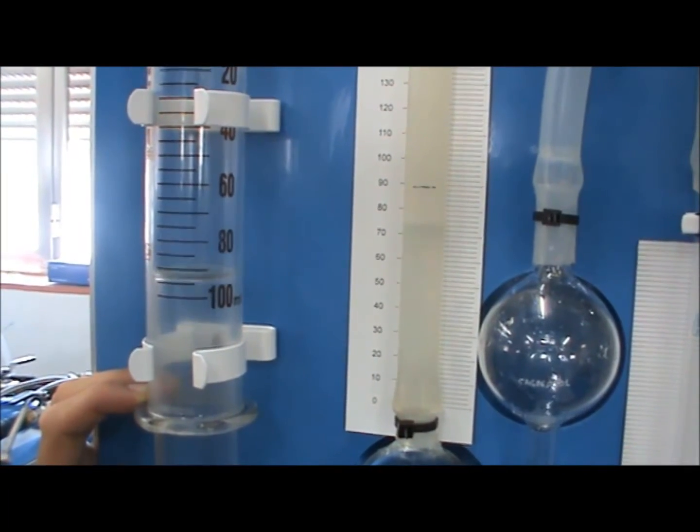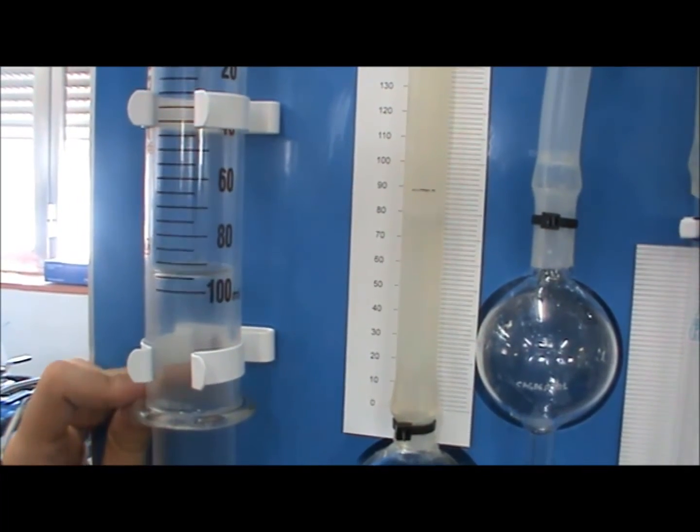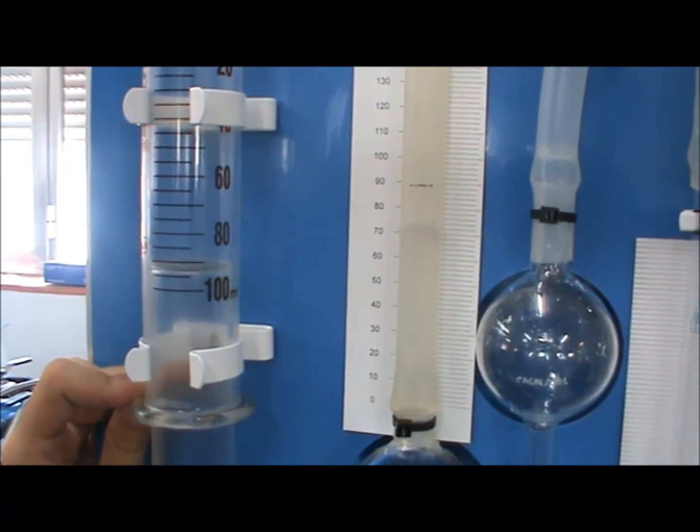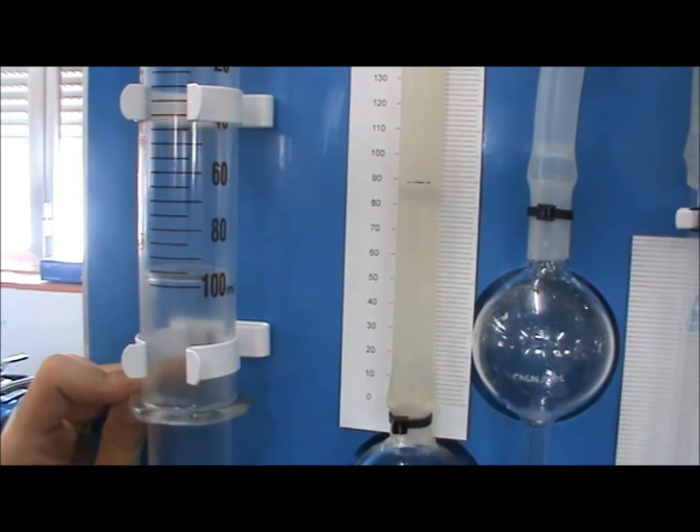Repeat these steps, gently pushing the sample into the vessel. Do not try to force the sample all at once. It takes time for the KOH to absorb the CO2, so be patient.